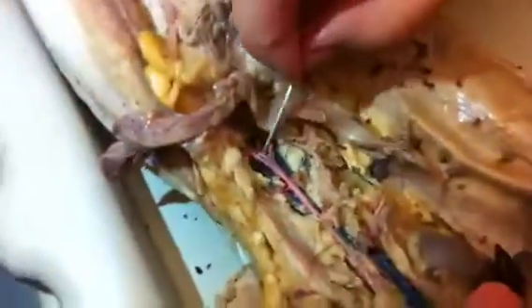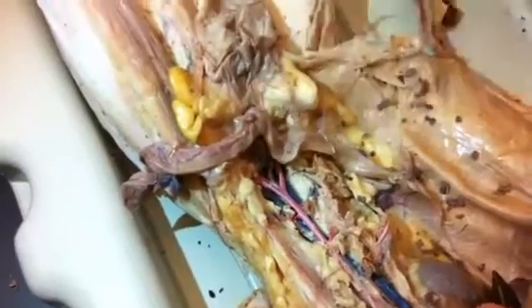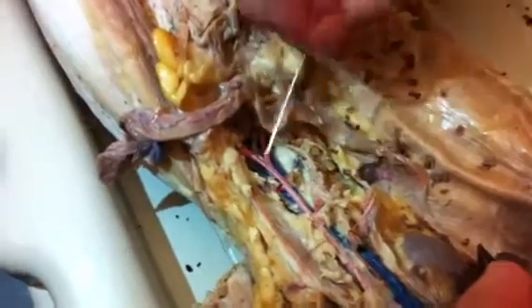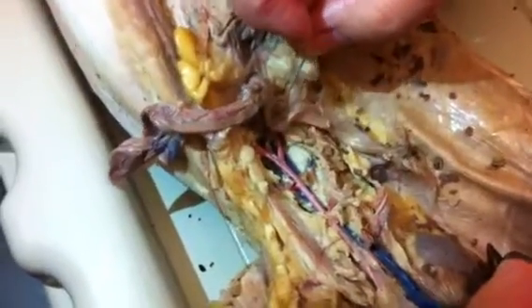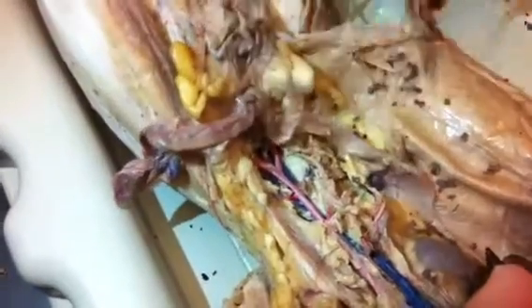So then we're coming down the aorta, and we've got two splits. The first split is we're going to split off the aorta. The aorta now disappears. This is the end of the aorta. What's next? The external iliac, then the internal iliac, and the caudal falls out after that for the tail. What is it? The caudal, the tail.